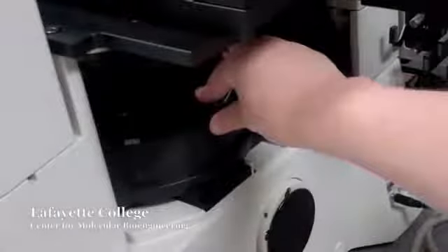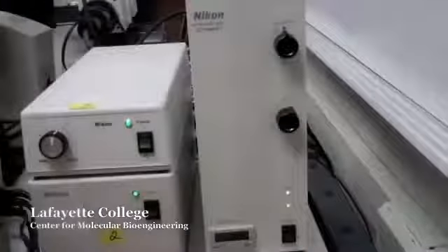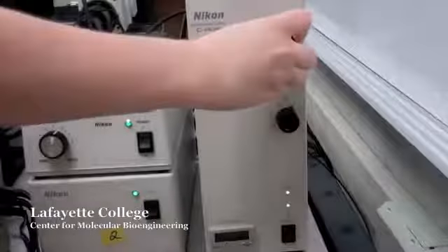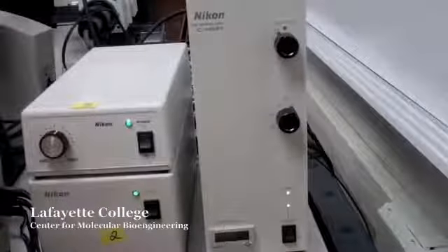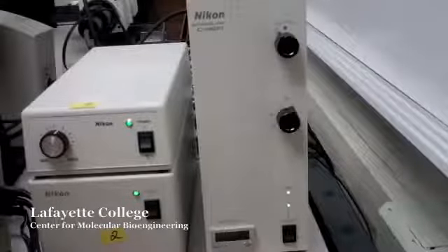To change to the desired filter, rotate the filter cubes on the microscope to the appropriately labeled tag. They are labeled by their initials UV, B, and G. Switch the shutter to the open position. The shutter on the microscope is labeled O for open and C for closed. The shutter can also be opened and closed from the Intensilight box. If the fluorescence imaging is not working, check that both of these switches are in the open position.